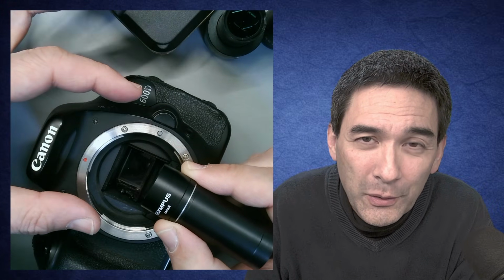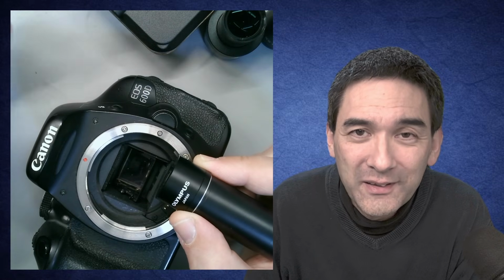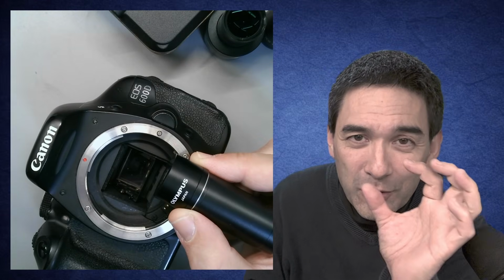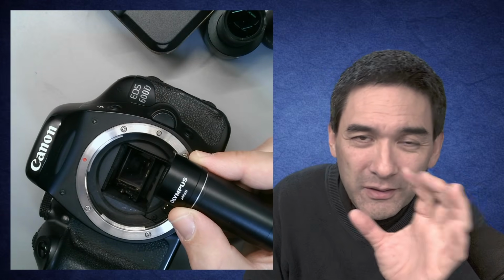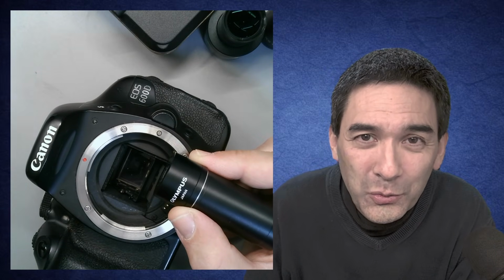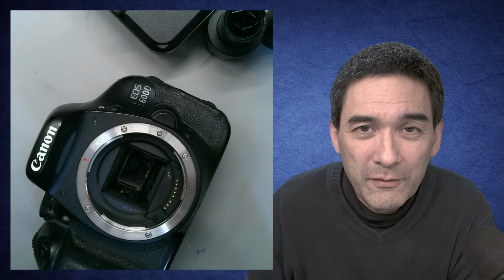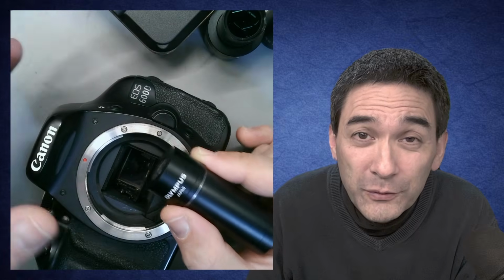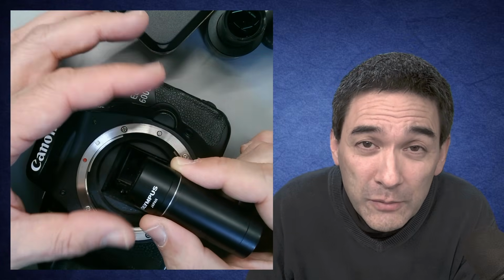It has to spread apart. If you don't do that, then you are not going to fill the full sensor, and you're just going to have an image in the center of the picture, and then everything else is going to be dark. You don't want that either. So if the picture is supposed to fill the frame and the sensor completely, you have to actually make it larger.